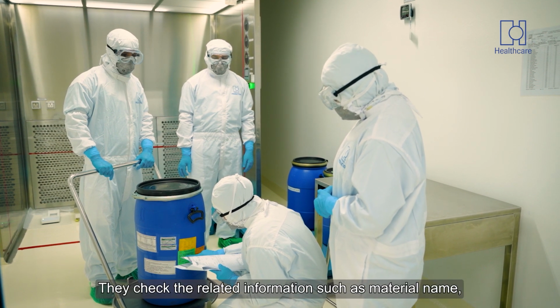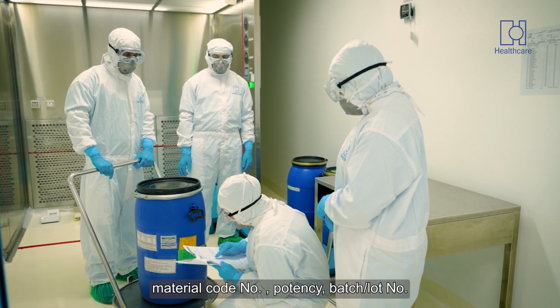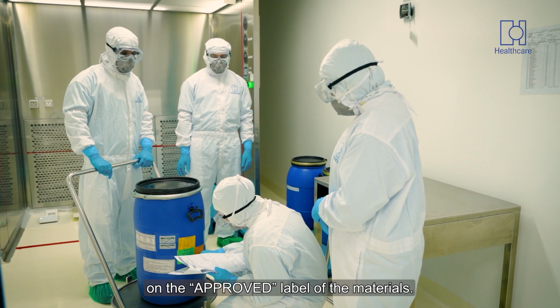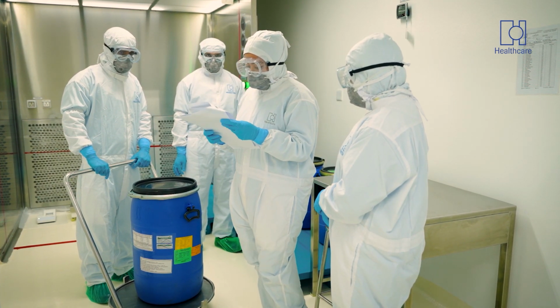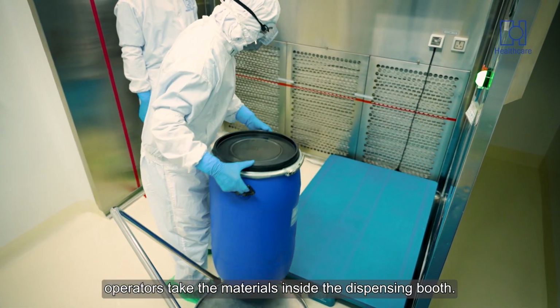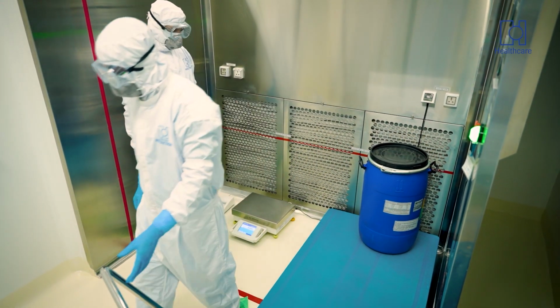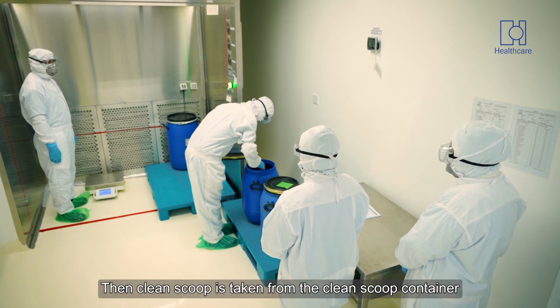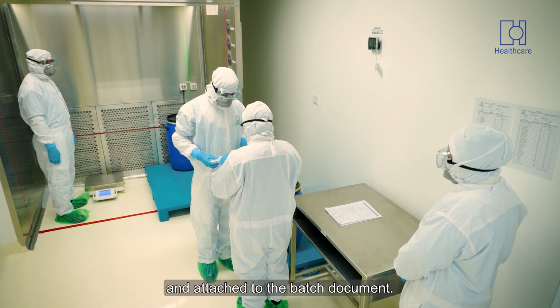They check the related information such as material name, material code number, potency, batch or lot number, in-house retest date, and expiry retest date on the approved label of the materials. After checking all the information, the operator takes the material inside the dispensing booth and opens the container. Then a clean scoop is taken from the clean scoop container and the clean label is checked by the production officer and attached to the batch document.